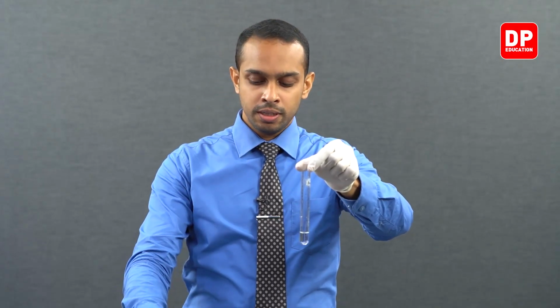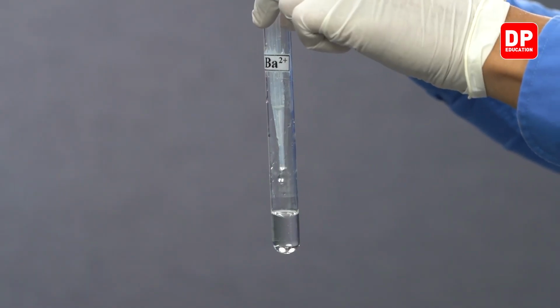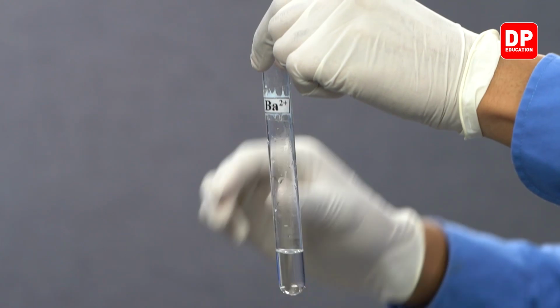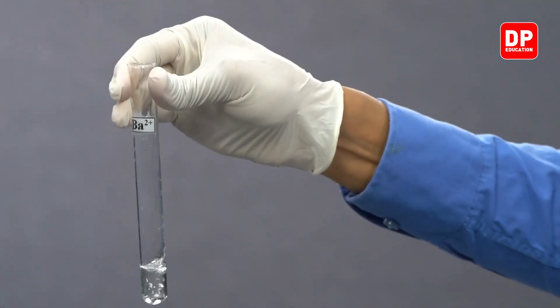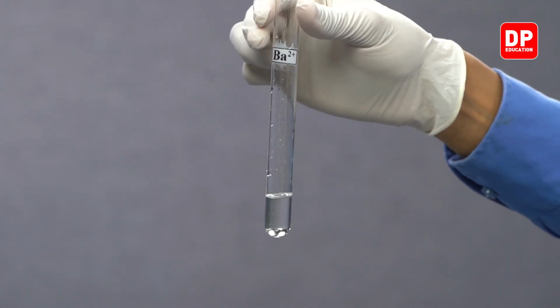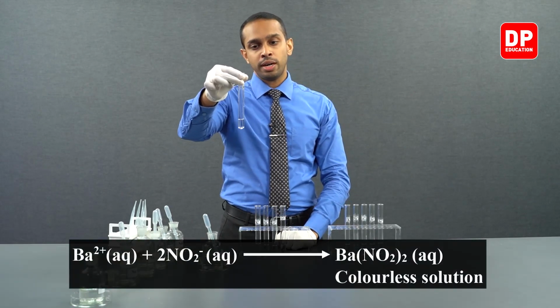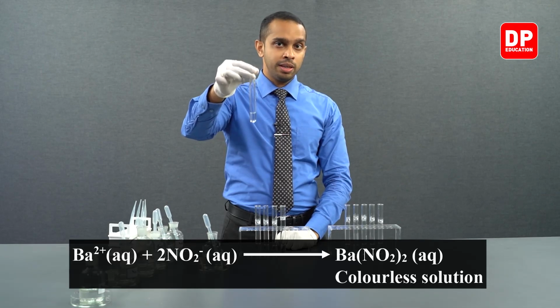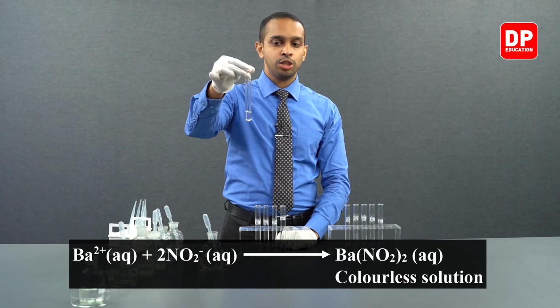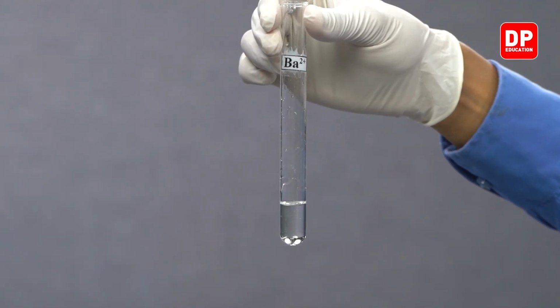When it comes to barium, we have a barium 2 plus aqueous ion solution. To that, let's add a small amount of nitrite ions, drop by drop, and let's mix it really well. And you can see we do not form a precipitate here as well, as barium ions and nitrite ions form barium nitrite, which is soluble in water. The salt barium nitrite is soluble in water, so therefore you will not see the formation of a precipitate.